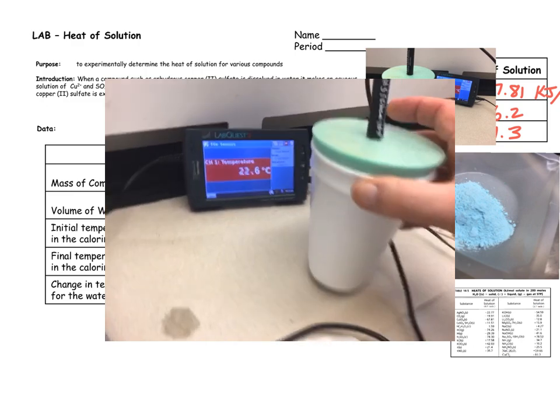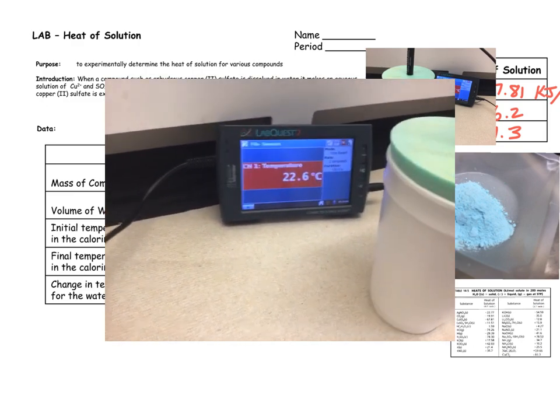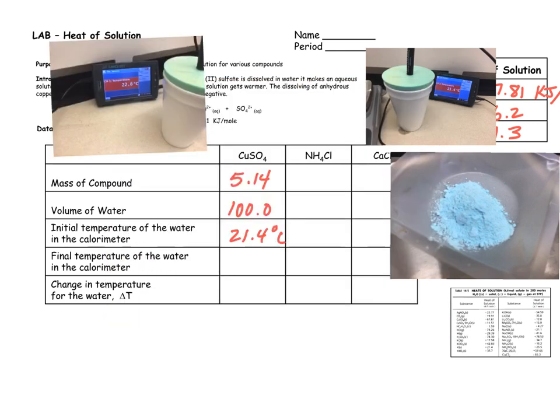Okay, it's been about a minute and the temperature is pretty much stabilized at 22.6 degrees. All right, let's record that. 22.6 degrees Celsius. The change in temperature then is the difference, 1.2 degrees Celsius. All right, that's our delta T.